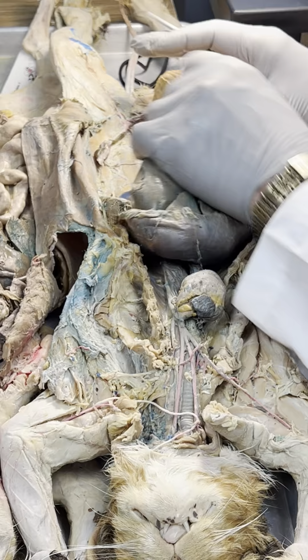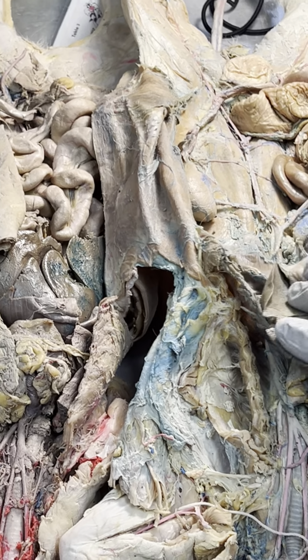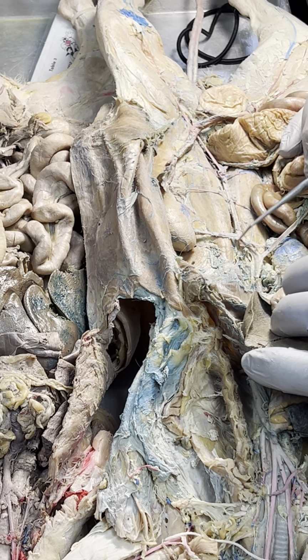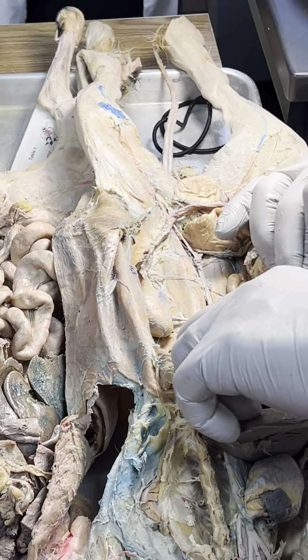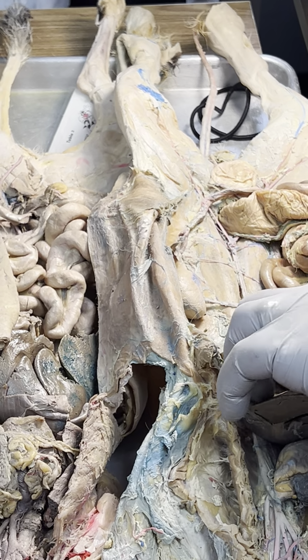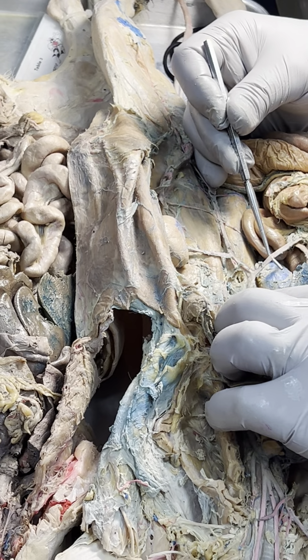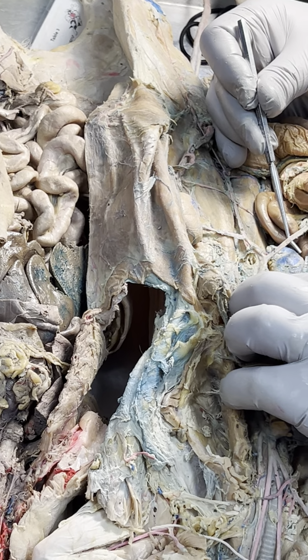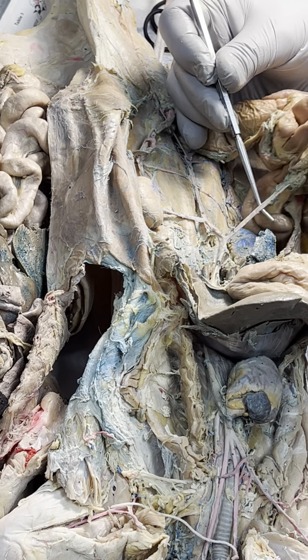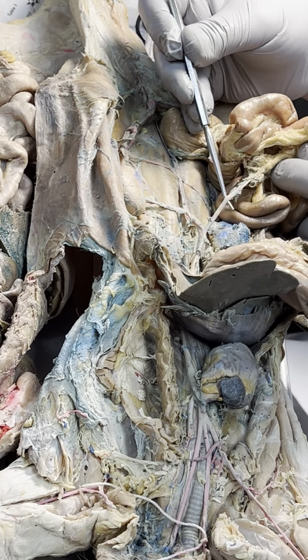So let's do the arteries. I got this guy nice and exposed down here. There is the abdominal aorta. So that's abdominal aorta, right? And this, the first branch, right? And the first branch would be celiac trunk, right? Is that celiac trunk though? Nope. Why is that? Because that's going to this. What is this? Mesentery proper. So that is superior mesenteric.